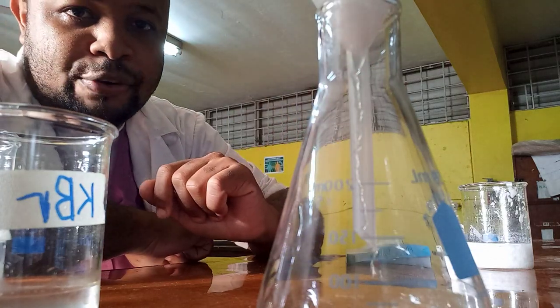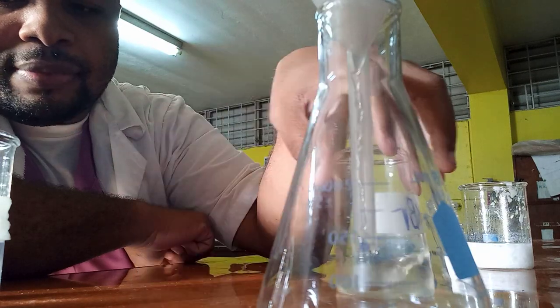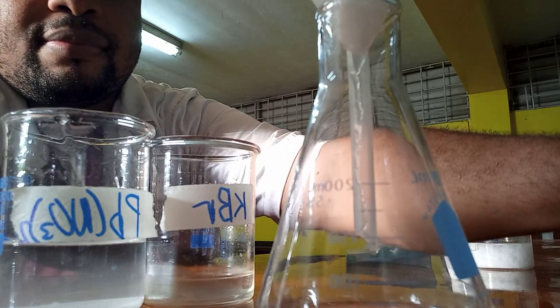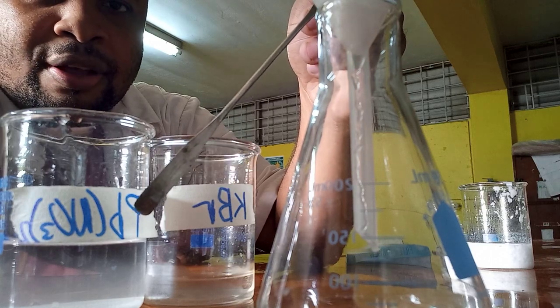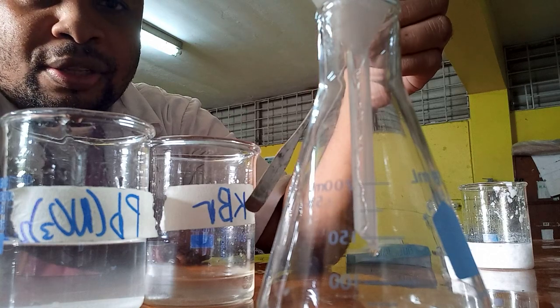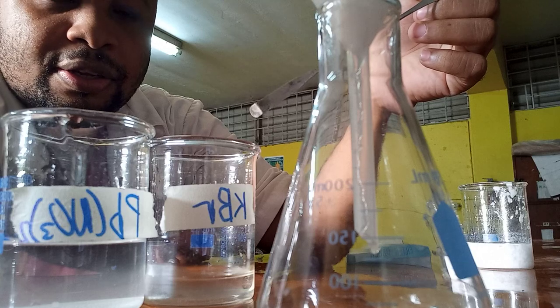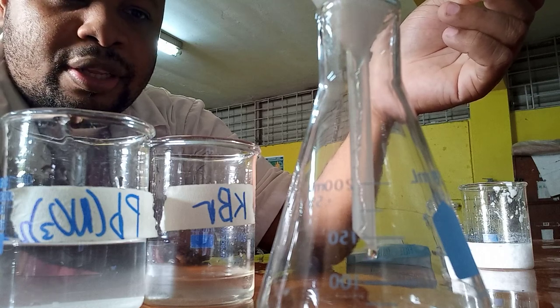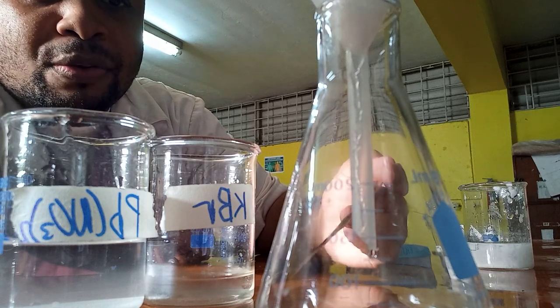So again, we had a solution of potassium bromide — a soluble salt — and we mixed it with lead nitrate, also a soluble salt. The bromide ion of potassium bromide combined with the lead ion of lead nitrate to form a white precipitate of lead bromide. The potassium ion combined with the nitrate ion to form potassium nitrate, which is a soluble salt. When we do filtration we are separating an insoluble substance from a soluble one — because potassium nitrate is soluble, that solution is filtered through into the conical flask.